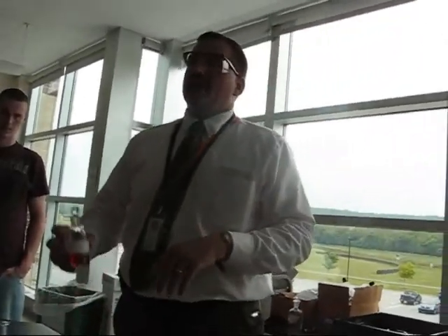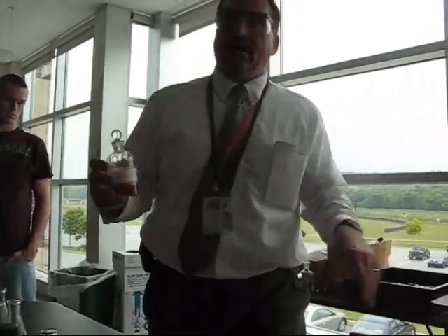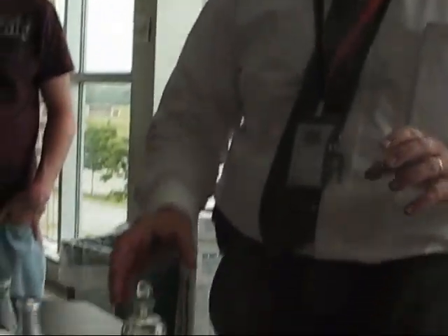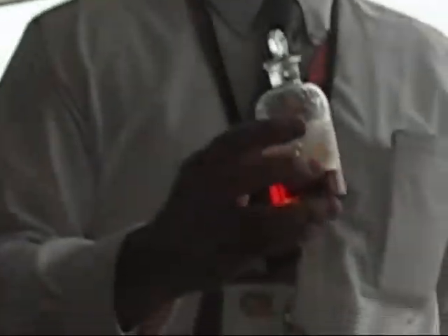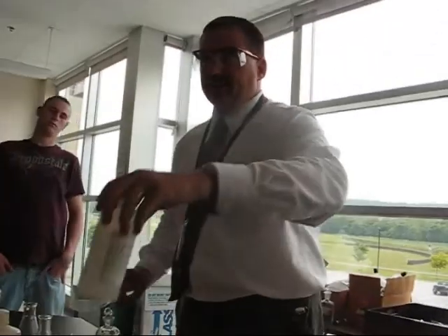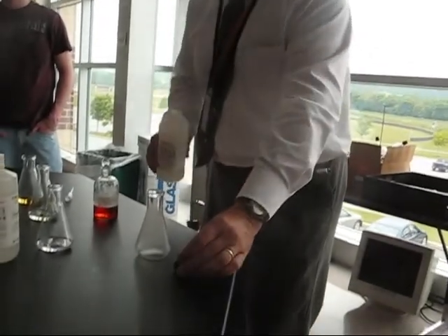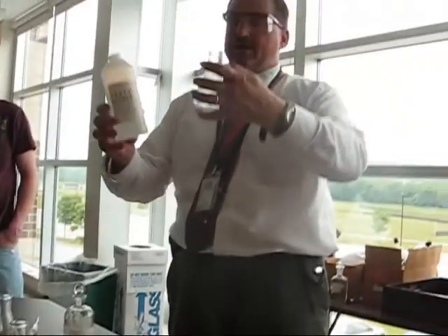I heard someone say chlorine is used. Pure chlorine is extremely hazardous, and it could be used for pools, but it's extremely diluted there. This is pretty much full-strength stuff, and it's dissolved in a little bit of chloroform. Chloroform is nothing to trifle with either, because chloroform is a pretty powerful anesthetic. It'll put you to sleep, and if you're not careful, you could end up with the big sleep with that stuff. So we're going to be careful and use that cautiously.